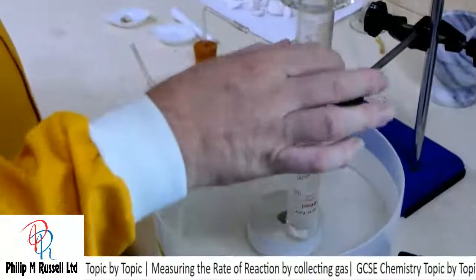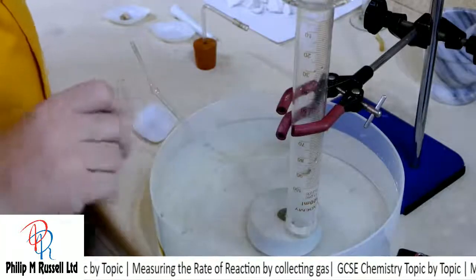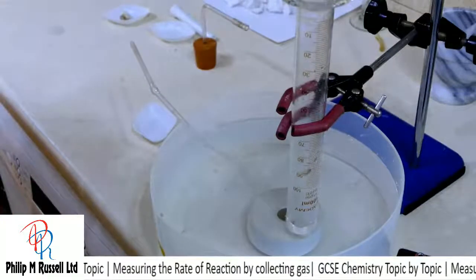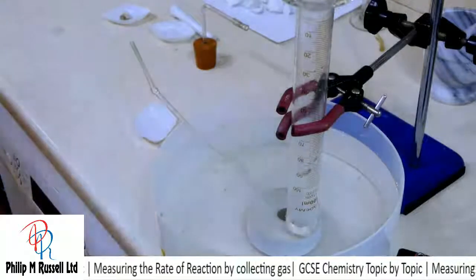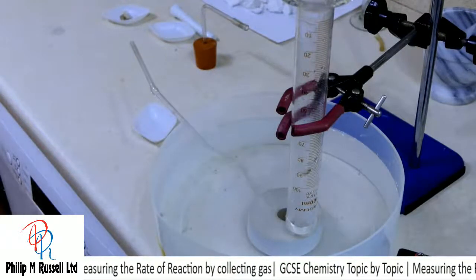So I've collected carbon dioxide here. I could prove that's carbon dioxide with a test for lime water. Of course, I tried that last time and it didn't work, so not to be defeated, I'm going to do it again.